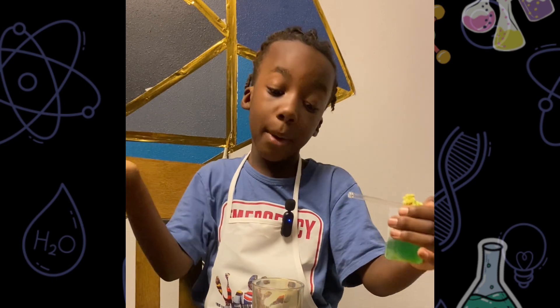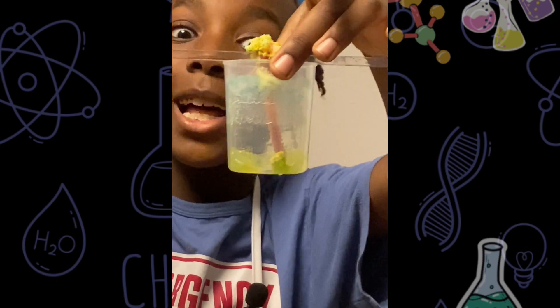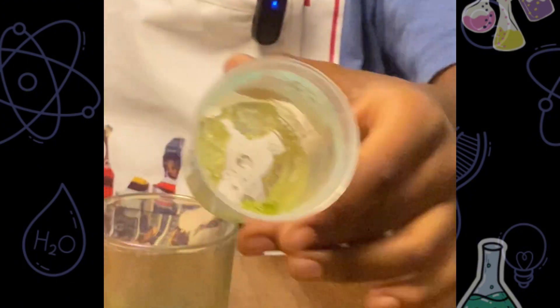So we're back. This is good, but this looks like a plant is growing out of here. But this — I love this. There are our alum crystals.